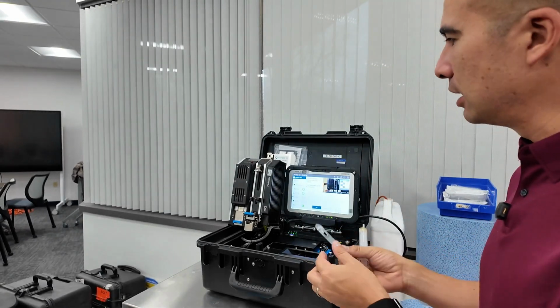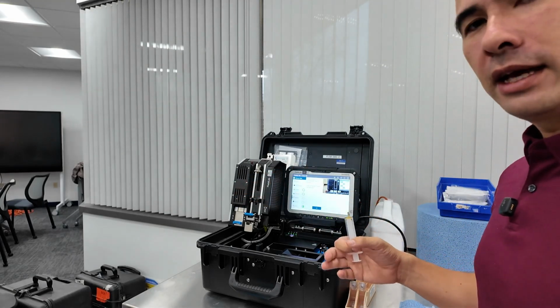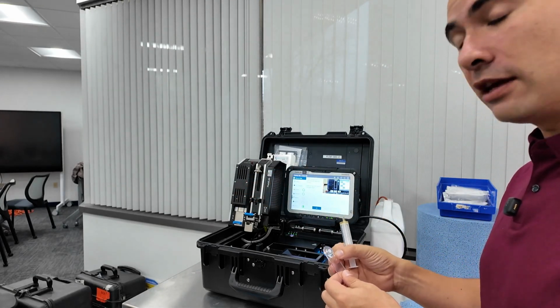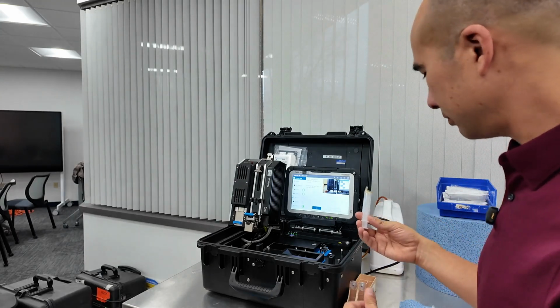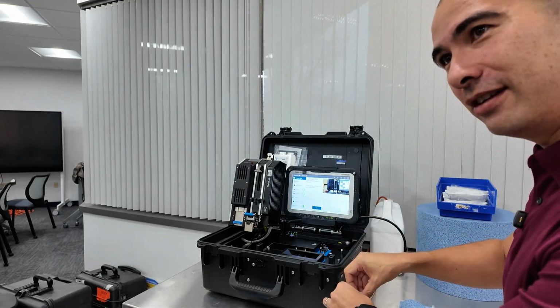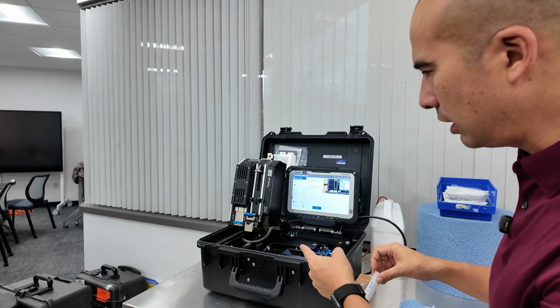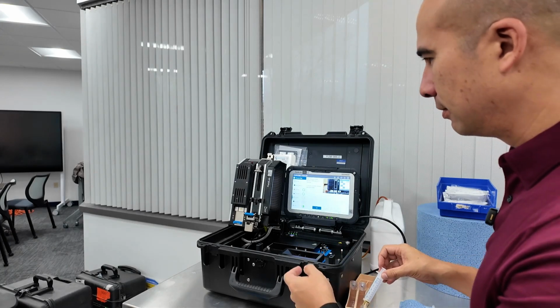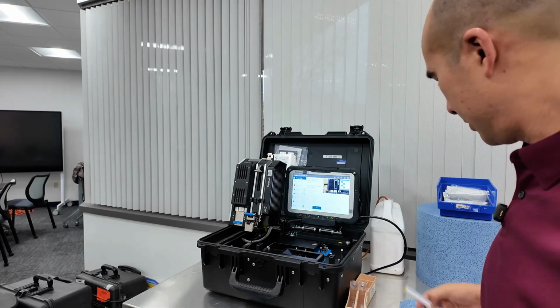Now, once that's done, we're going to be able to put it into the XRF, and we're going to be able to get elemental analysis of any of the wear debris that is on the patch. So I'm just drawing this in here. You're going to put the filtergram in there. Oh, isn't there one in there for the 0? That's the one you want to take out and move to the particle count. Oh, yeah, I forgot the steps here.